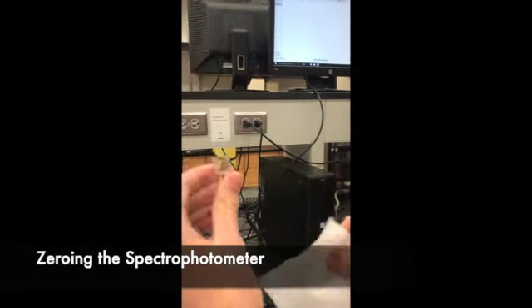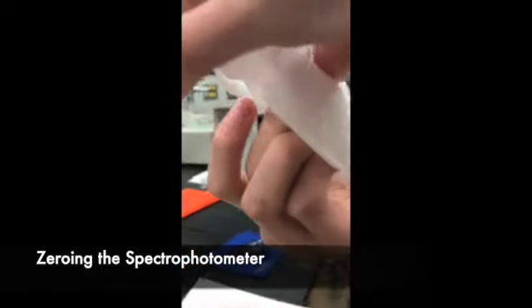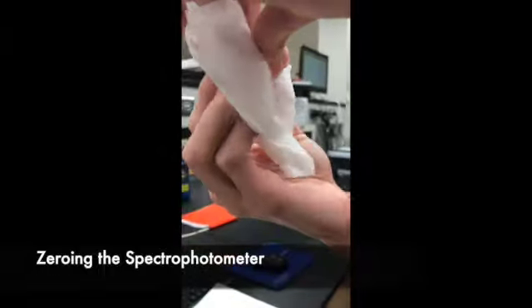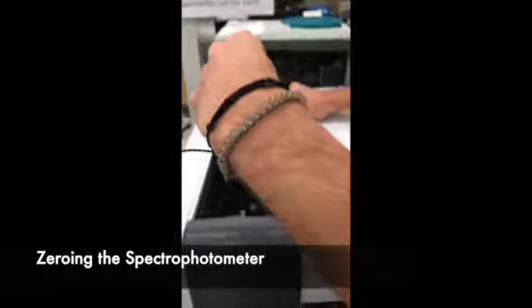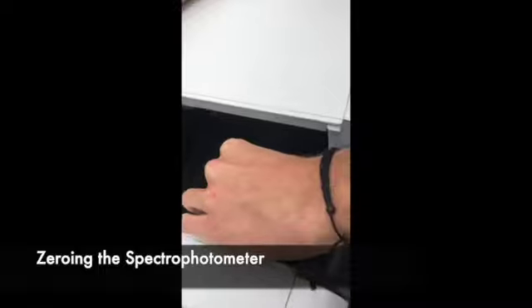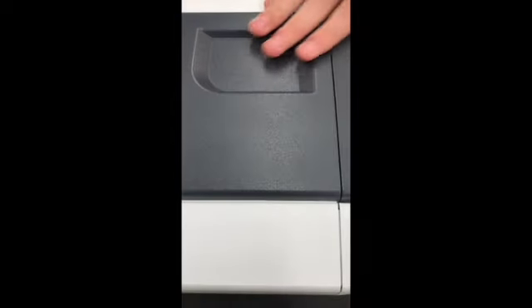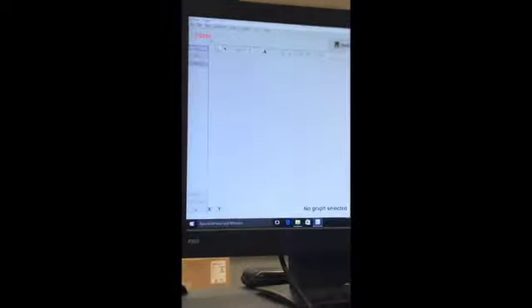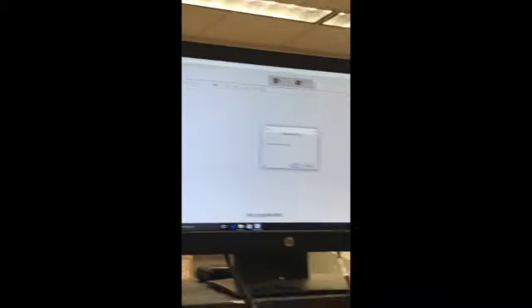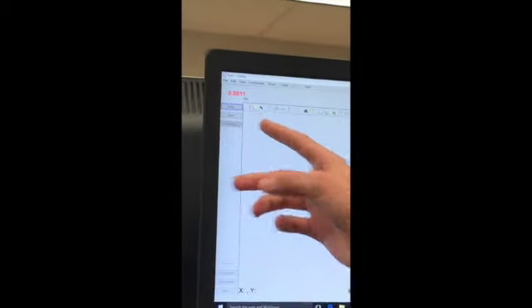After making sure that we clean the sides that light will be passing through on the cuvette, we are now ready to insert our blank cuvette, which in this case will be holding water to zero the spectrophotometer. Closing the door to the spectrophotometer, we now see that we are going to get a reading that is close to zero. This means that we can move on with the procedure.